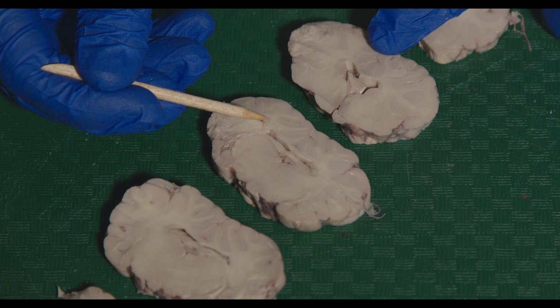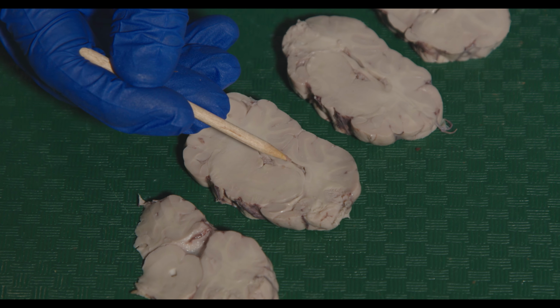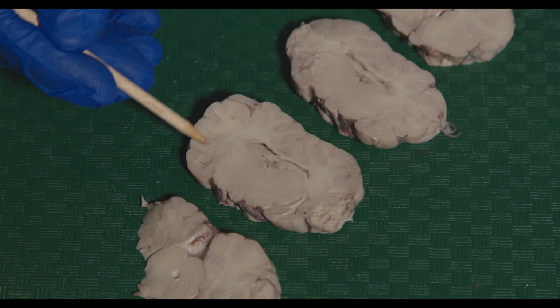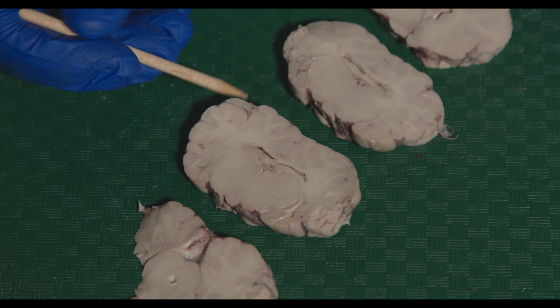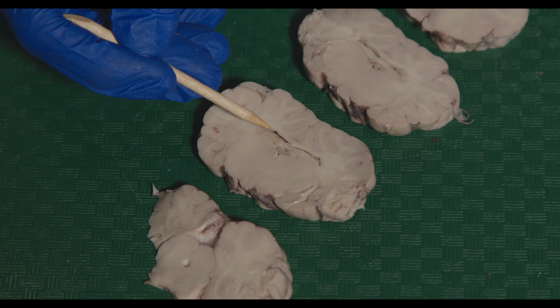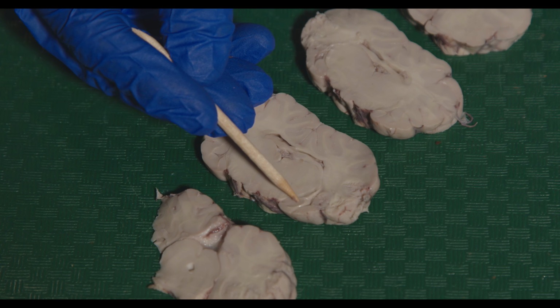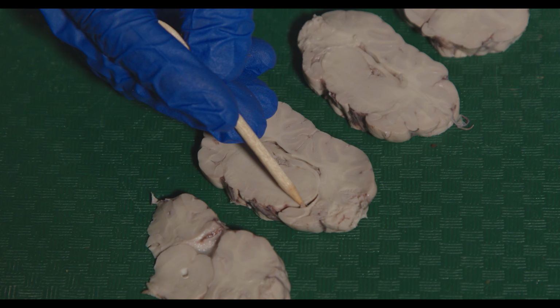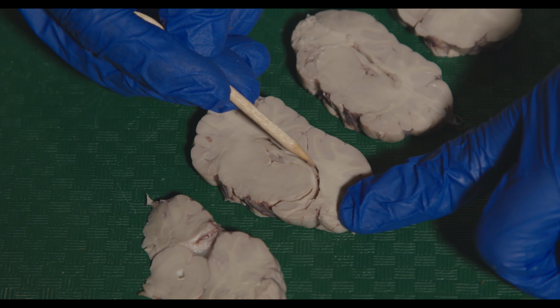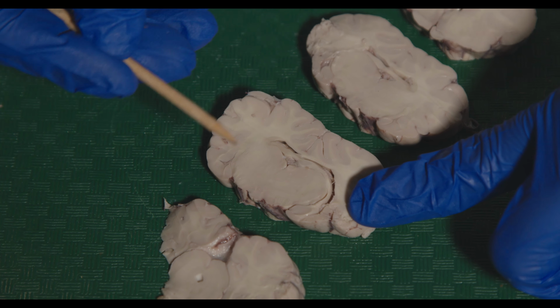If we go a little bit further back, a little more caudal, we can start to see the fornix forming into the hippocampus. So the hippocampus has a seahorse shape and it wraps around. You'll see this most prominently in subsequent labs, but you can see part of it come and wrap around, and then you can see a ventral part of it here. So this is the hippocampus, which we can see really prominently. You can see how it wraps around and then comes up to form the fornix. So it would wrap around and come out this way.